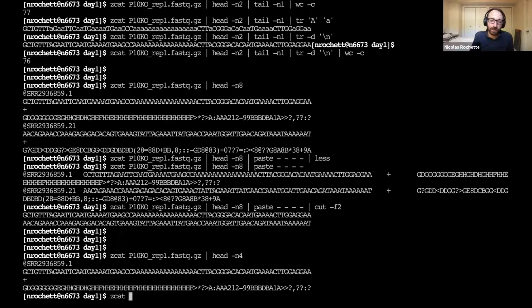And here we do have to be careful because this file again is compressed. And so the characters in this compressed file are essentially random. And among those random characters, we have new line characters. So if you just try the wc command on the compressed file, it's going to work. It's going to output something. But all it does is count the number of randomly occurring bytes that correspond to a new line character. It's not actually counting the lines because you don't have lines in a binary file, in a non-text file.